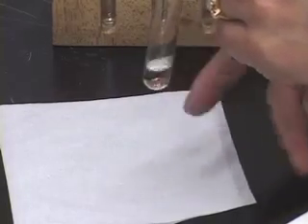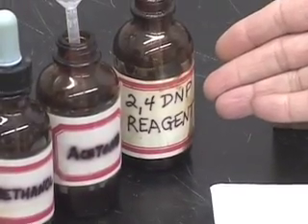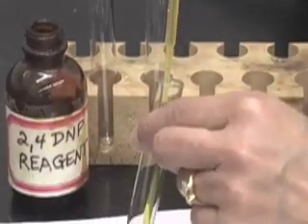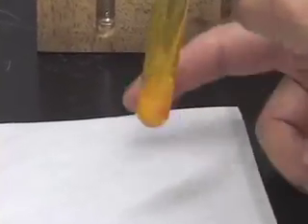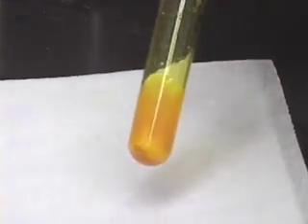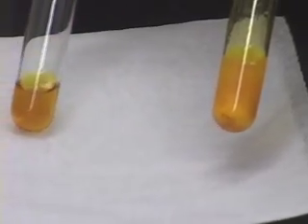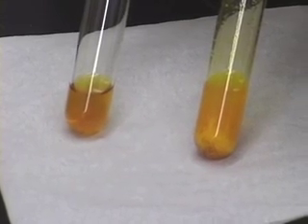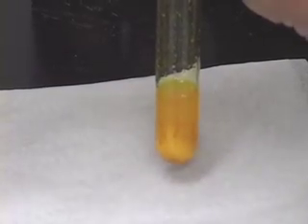To this solution of acetone in 95% ethanol, I am going to add 1 ml of 2,4-DNP reagent. Mix the contents well and notice what happened — we got a nice yellow precipitate. This is how the 2,4-DNP reagent looked before, and this is what happened after adding it to acetone, which is a ketone: we got a yellow precipitate.